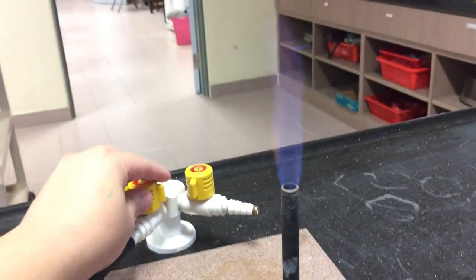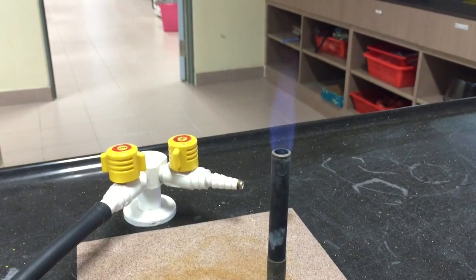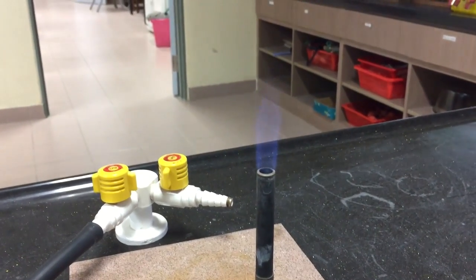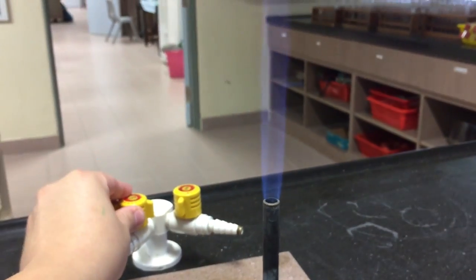While heating gently, you should use a smaller flame by lowering the gas flow. When you wish to heat strongly, you can then increase the gas flow to increase the flame intensity.